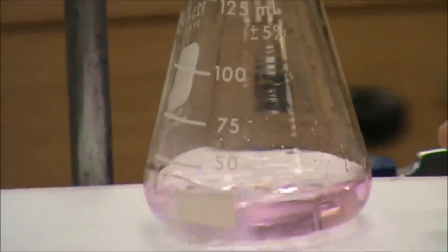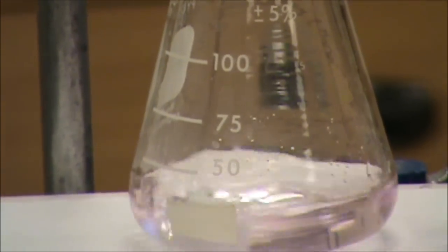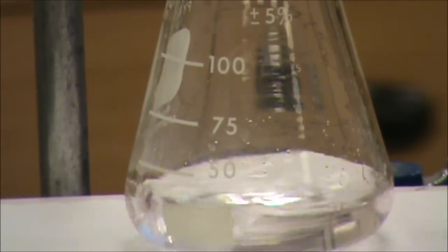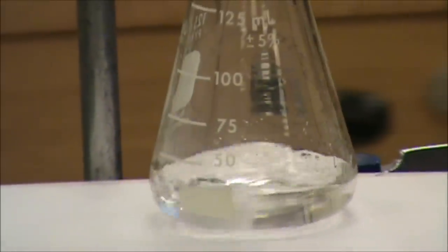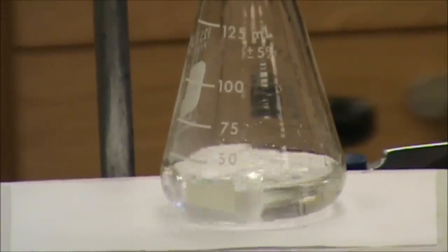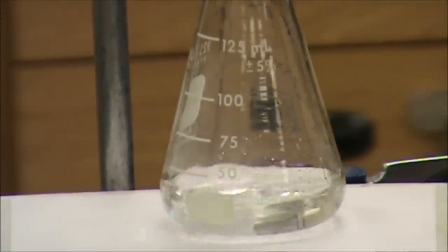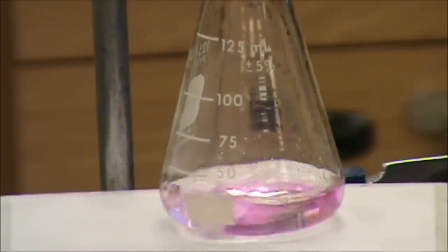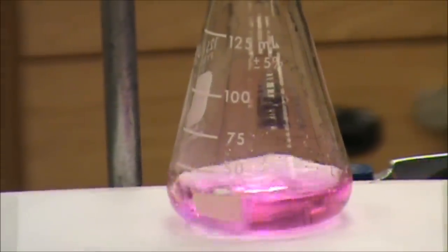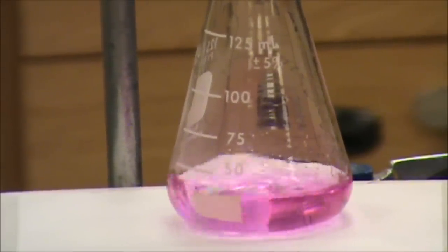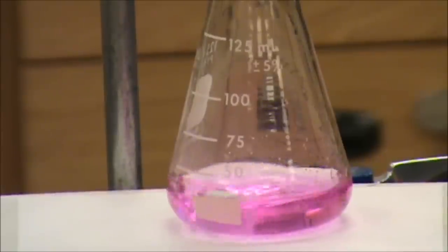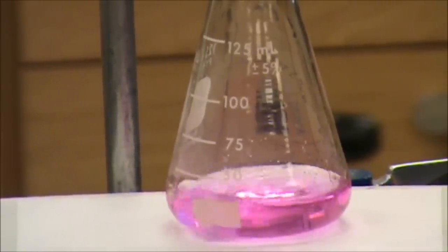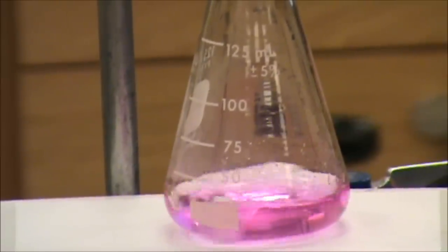Notice that our purple color is faint. Perhaps one more drop. It's being obstinate. One more drop of titrant. And there we go. There's our color. That's our endpoint. And this one looks like it's going to stick around for about 60 seconds. So there is our endpoint.